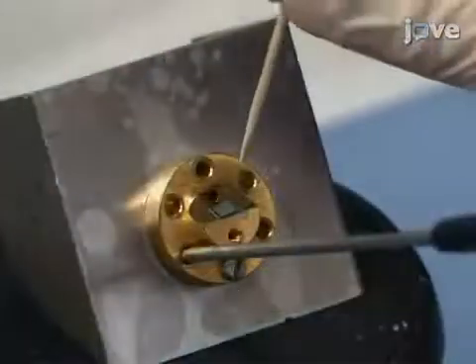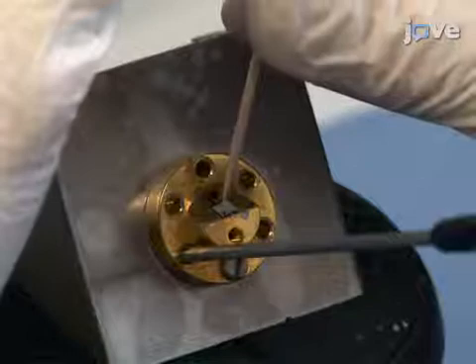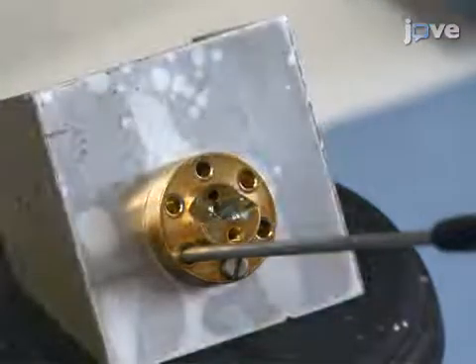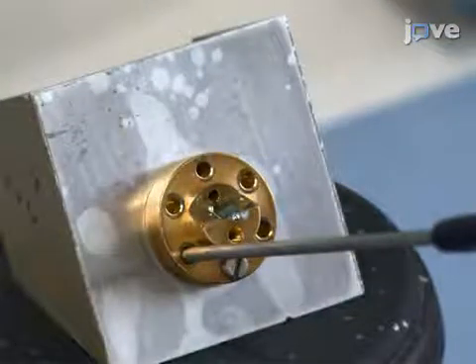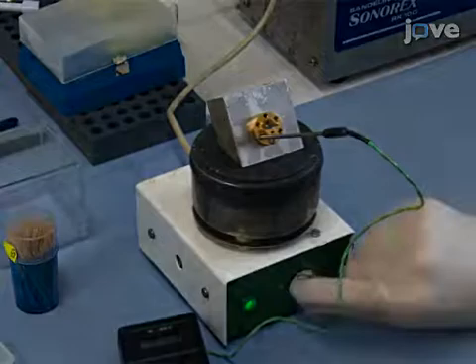Once heated, press on the sample with a wooden toothpick for one second in order to fix the sample onto the indium foil. Then switch off the heating plate and cool the socket.